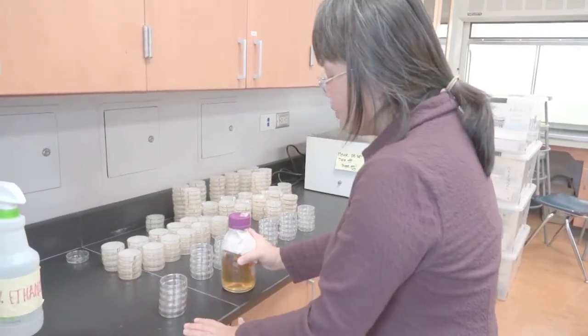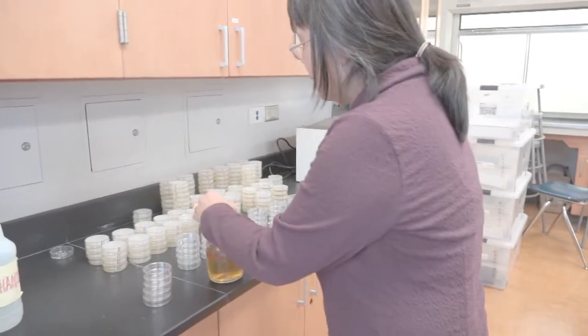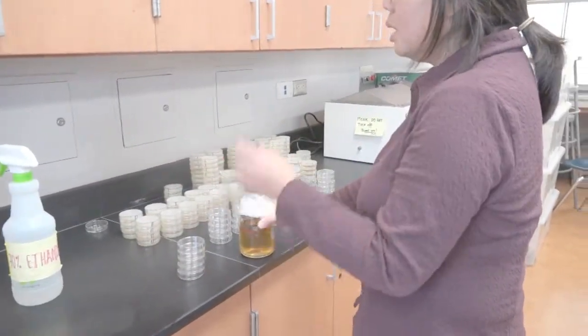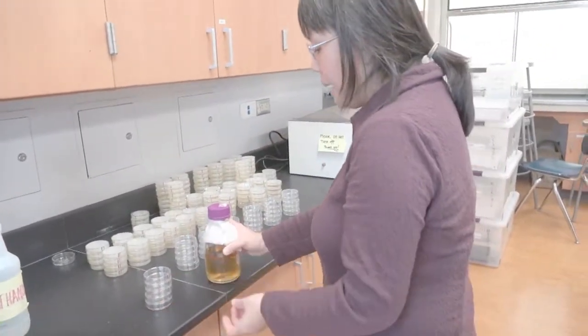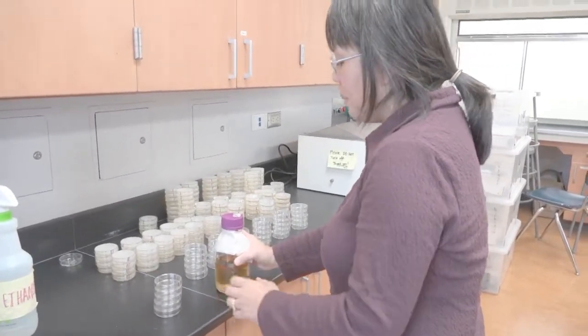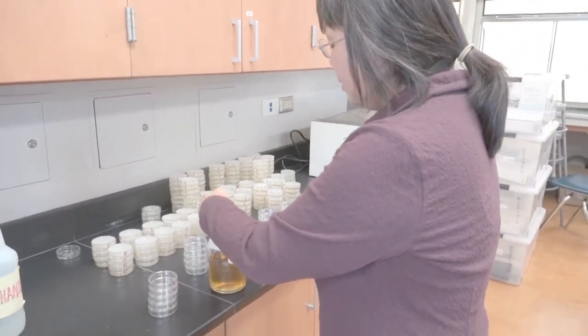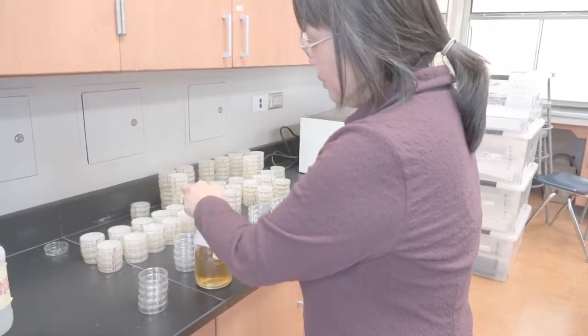We'll start with our first set of five plates. Notice we're not using a hood, and I'm not using a flame. The idea is that you just want to pour as quickly as possible so that it can remain sterile. I have never found it to be a problem.